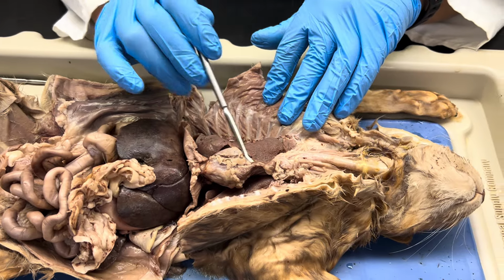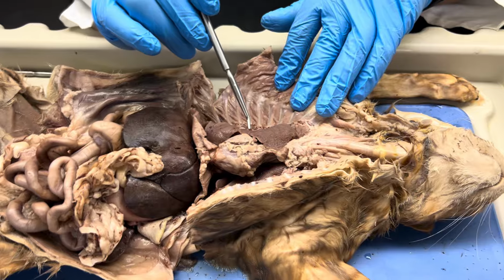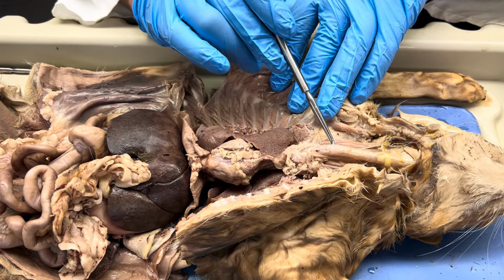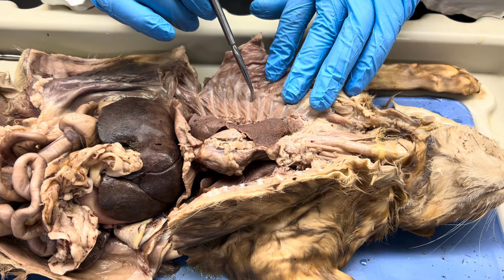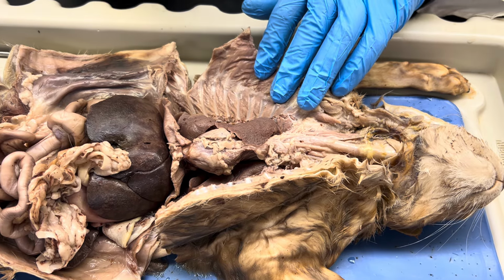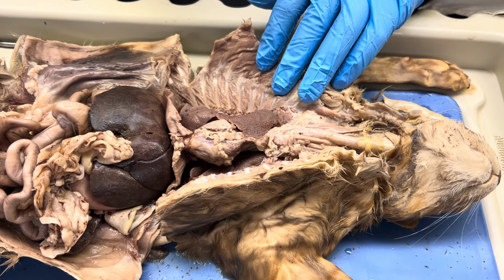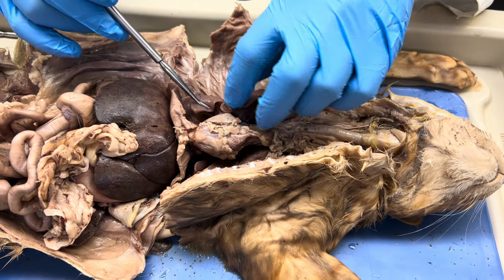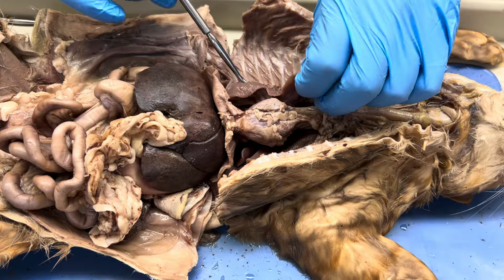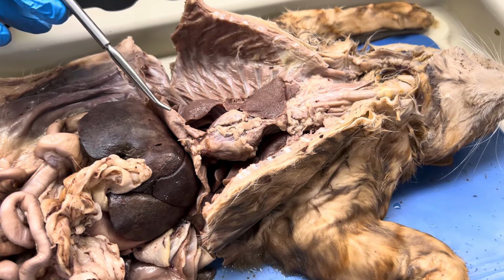All right, so let's move now down toward the thoracic cavity here. They start out again with the trachea, so you got that already. They next mention the pleural cavities, and this goes back to something that you heard about in A&P1, the pleura. They're the serous membranes that will surround the lung. So this is one lung over here. It doesn't have the same number of lobes, so don't try to do any lobe type stuff on the cat.